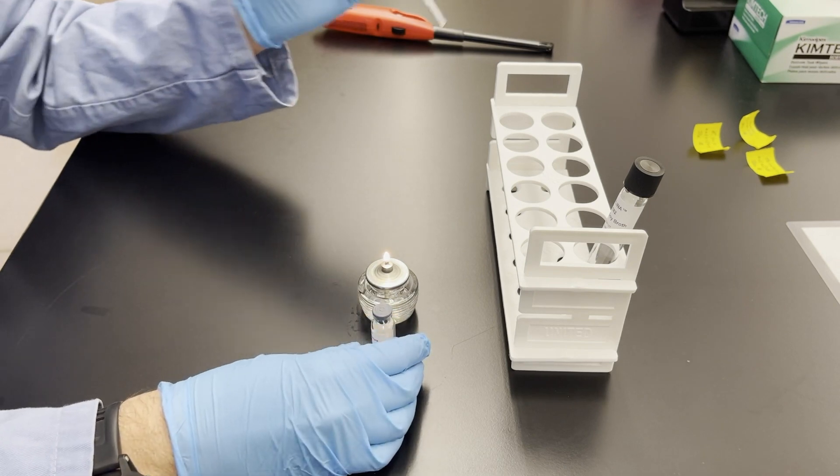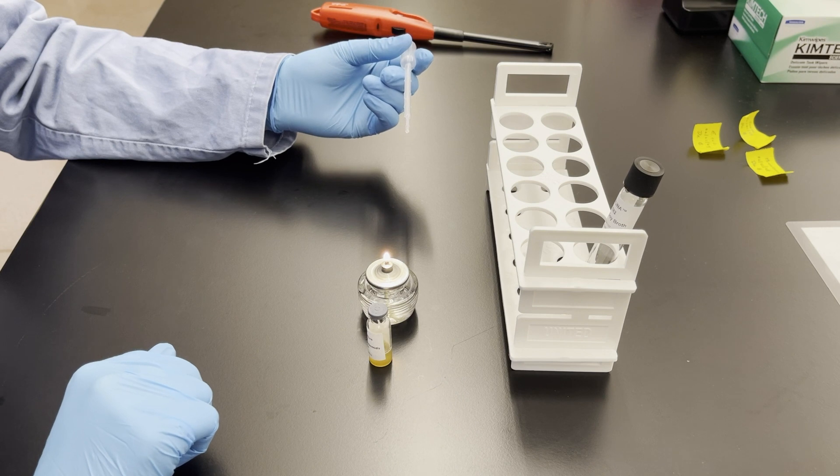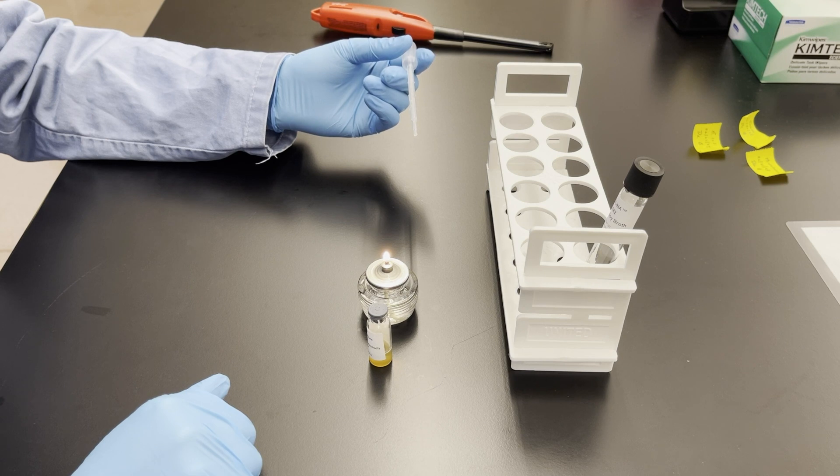And so that liquid is going to reactivate the bacteria and it's supposed to sit for about 30 seconds to let that nutrient-rich media actually activate those bacterial cells that have been dried.